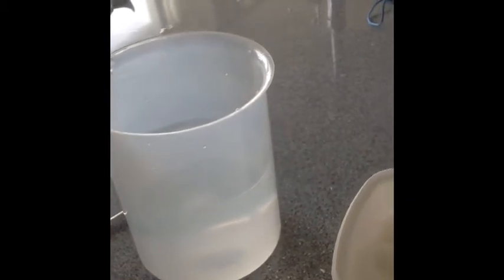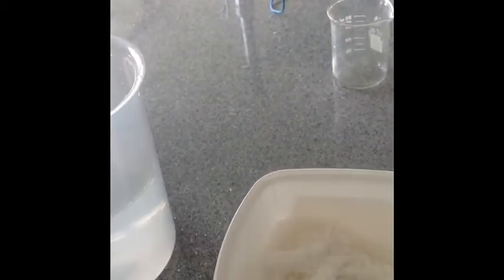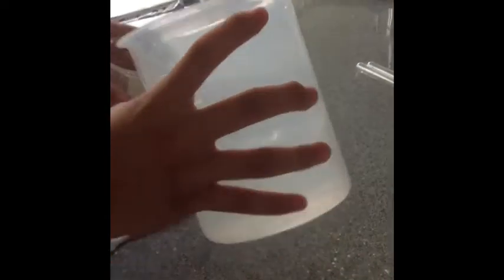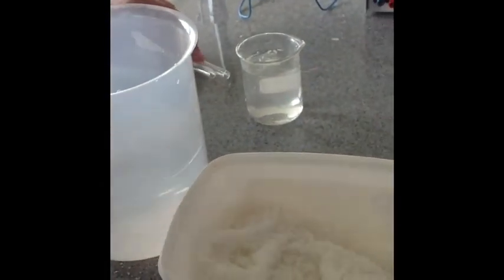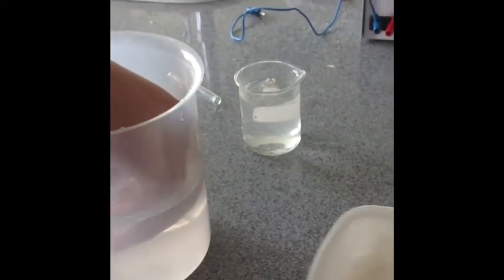Now we're going to pour the salt water into the smaller beaker, also filling up the two test tubes without any air bubbles.